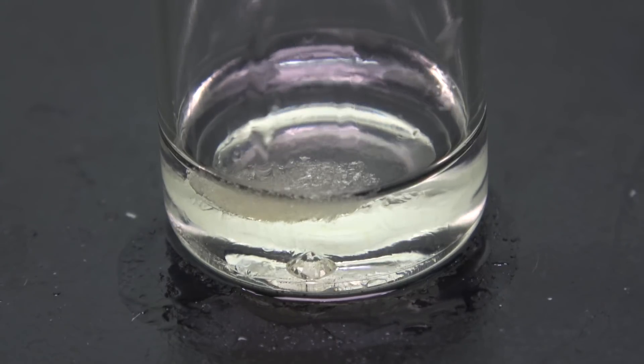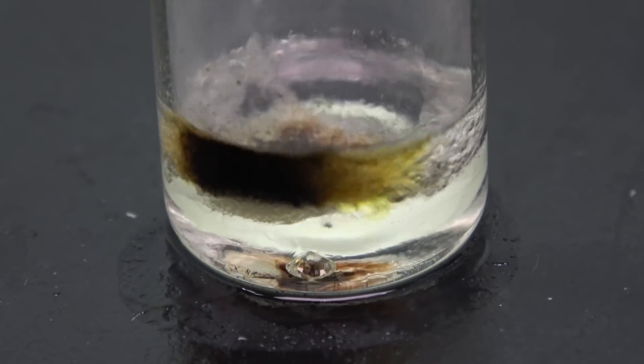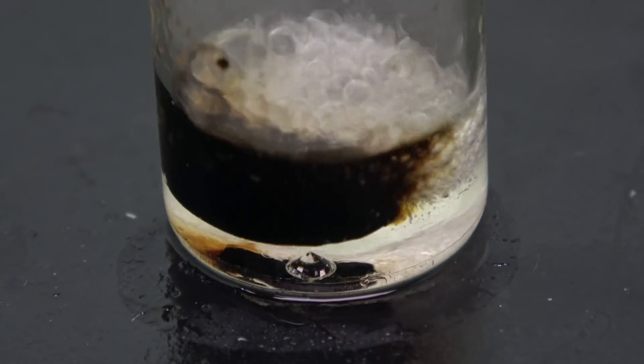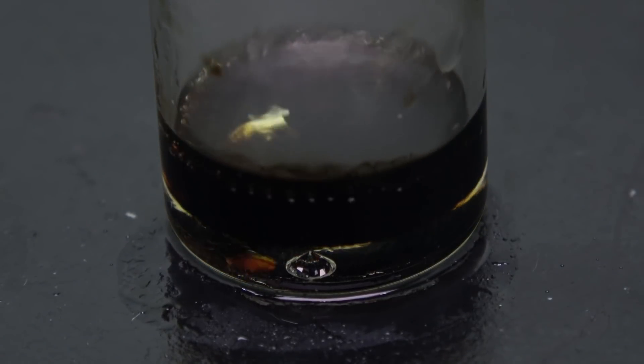Okay, let's go back a little and play it at real-time speed. As I add in the hydrogen peroxide, the reaction took off almost instantaneously.